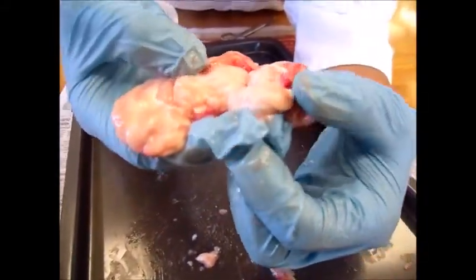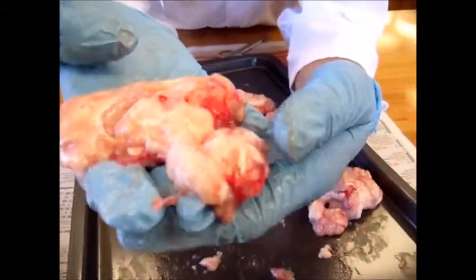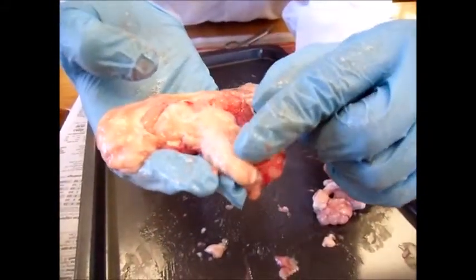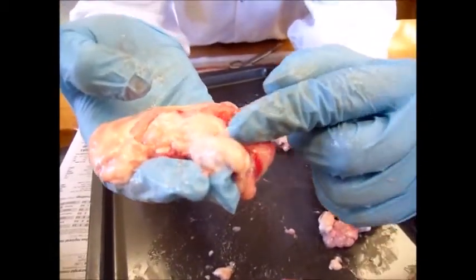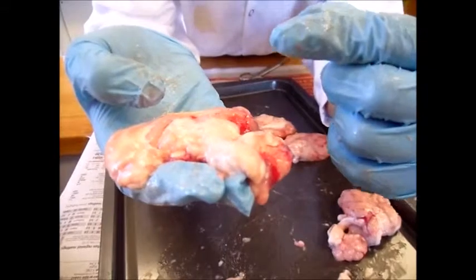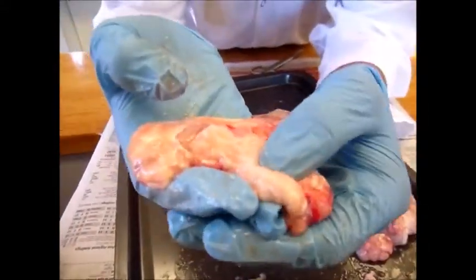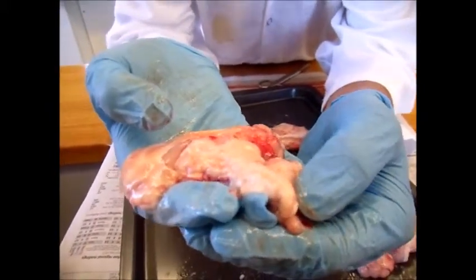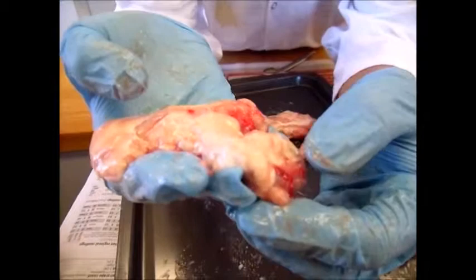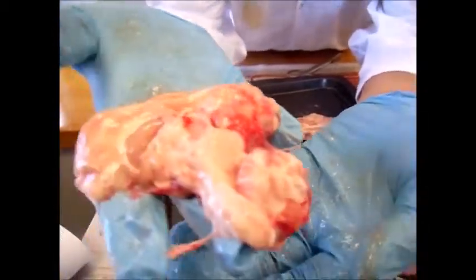The spinal cord is actually an extension of the brain through the vertebral column. It receives sensory information from all parts of the body below the head and uses this information for reflex responses to pain and relays sensory information to the brain and cerebral cortex. The spinal cord also generates nerve impulses and nerves that control the muscles and viscera, both through reflex activities and voluntary commands from the cerebrum. This is the lamb brain.